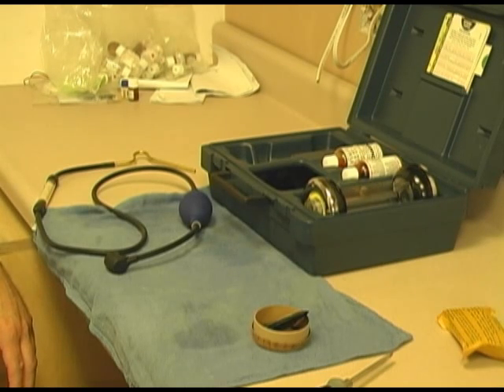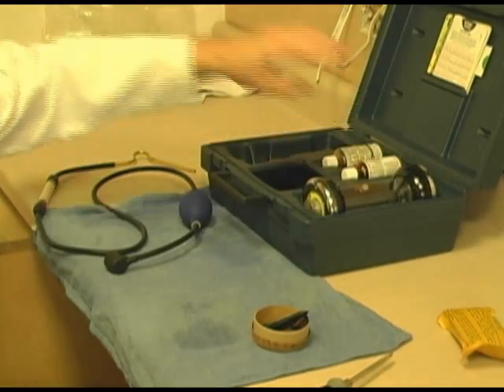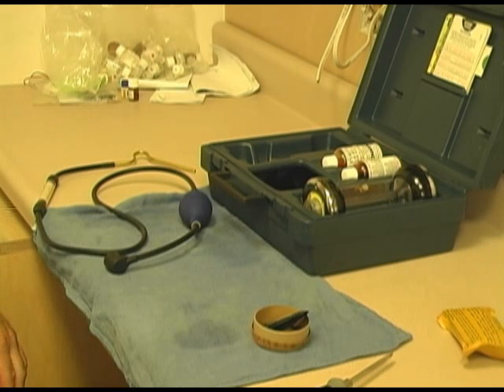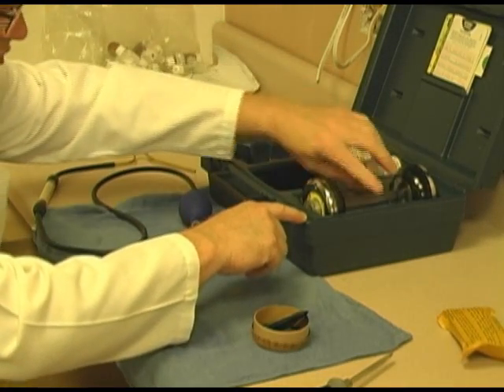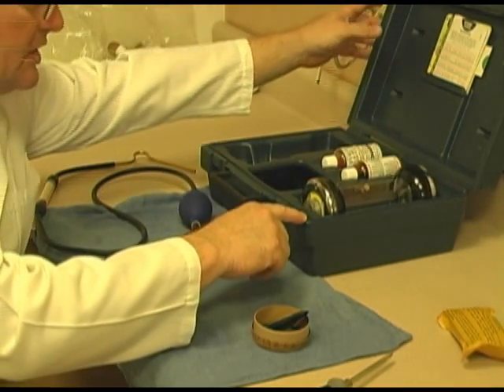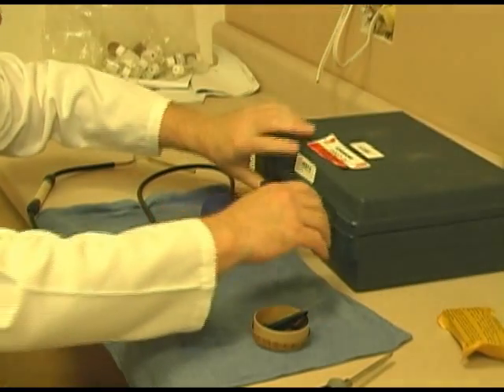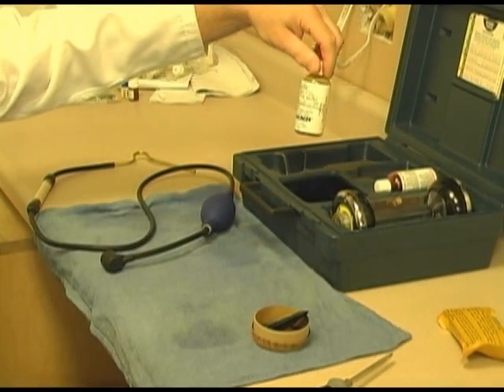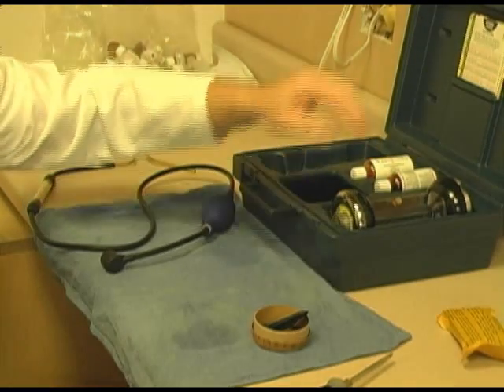We're going to continue with the maintenance on the Fyrite analyzer. Please note that this one is set in flat. That is not how you want to store it. The things I'm about to show you is what happens when the instrument is stored in a flat position. This case is designed so the Fyrite only goes in one spot, and you want to keep it set up like this. The reason being is because the Fyrite material is very corrosive and it eats up the plastic.